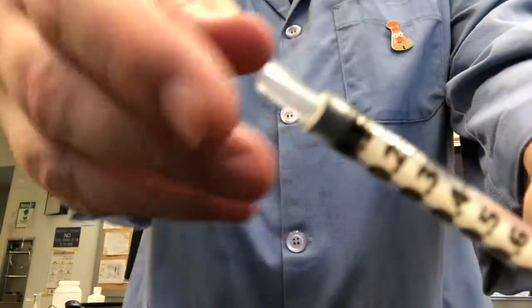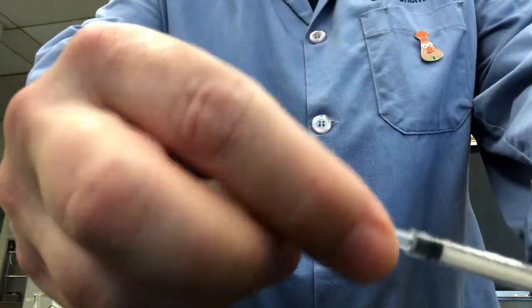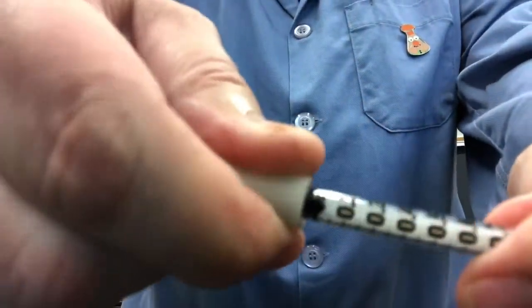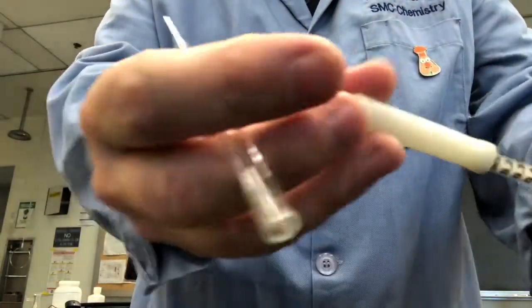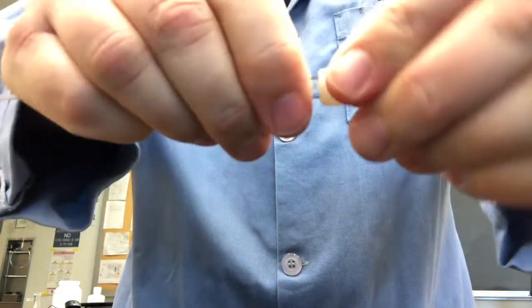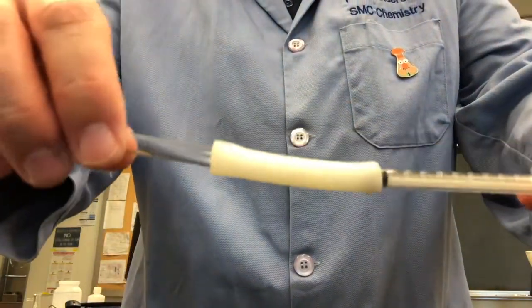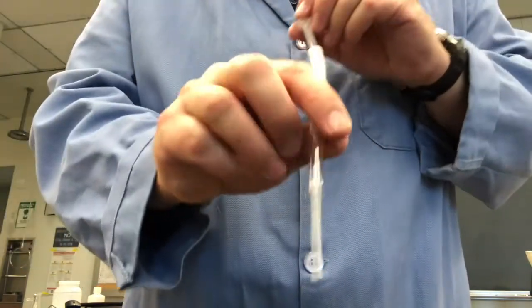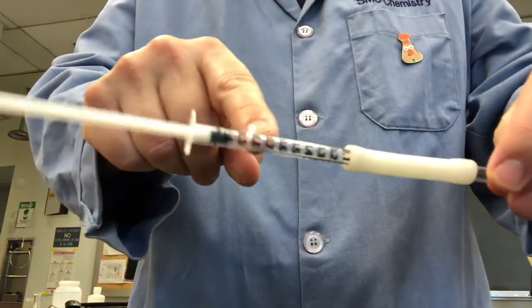We'll start by making a syringe pipette. In the syringe pipette, we take our syringe, which is scaled in 0.1 ml increments. We place a piece of Tygon tubing tightly over the end, making sure the Tygon tubing does not slip. It needs to be firmly placed onto the end so that no air leaks. And then we can insert a Pasteur pipette into the other end of the Tygon tubing, again making sure that there are no air leaks. It must fit tightly so that when we draw back on the syringe, we're able to pull a fairly precise amount of liquid into the pipette. Check the syringe plunger to see that it works and that there's no liquid in the syringe before we start.